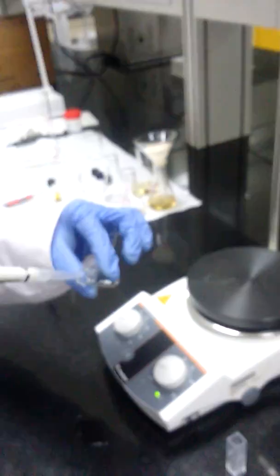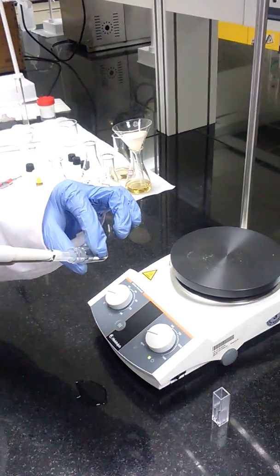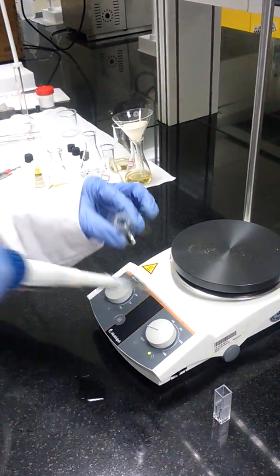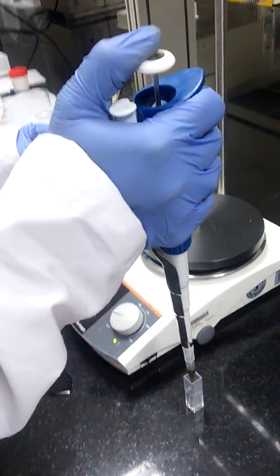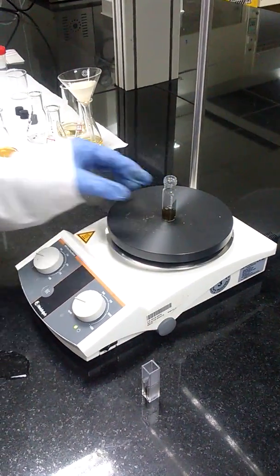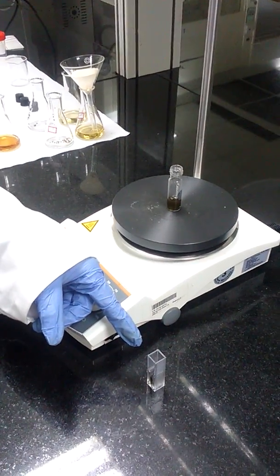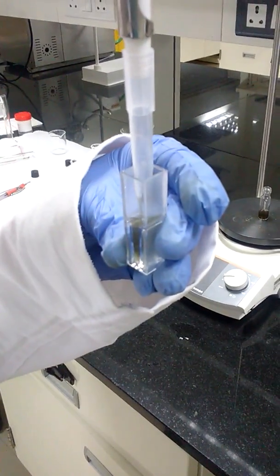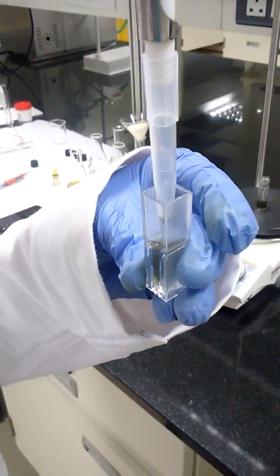Take 500 microliters of nanoparticles to a UV cuvette. Make up to 1 ml and mix the solution.